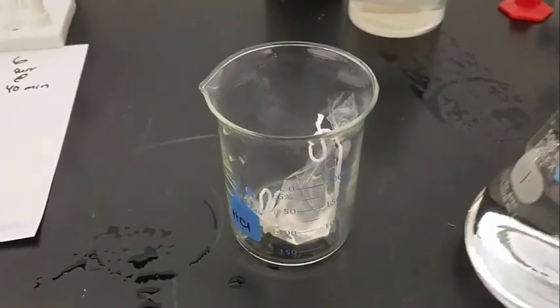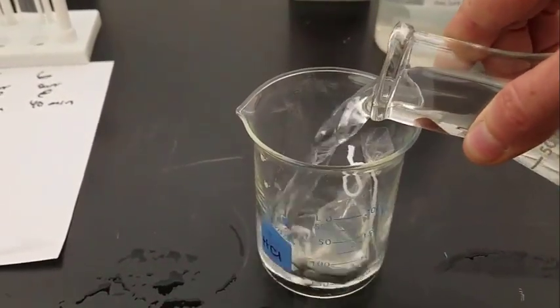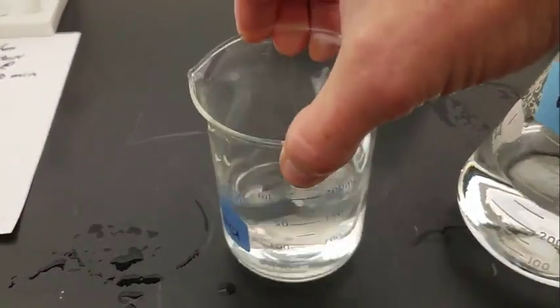We'll save a little bit of that blood and put it into test tube one. With the dialysis tubing, we're going to cover it with distilled water, so there's no ions or solutes in the water.